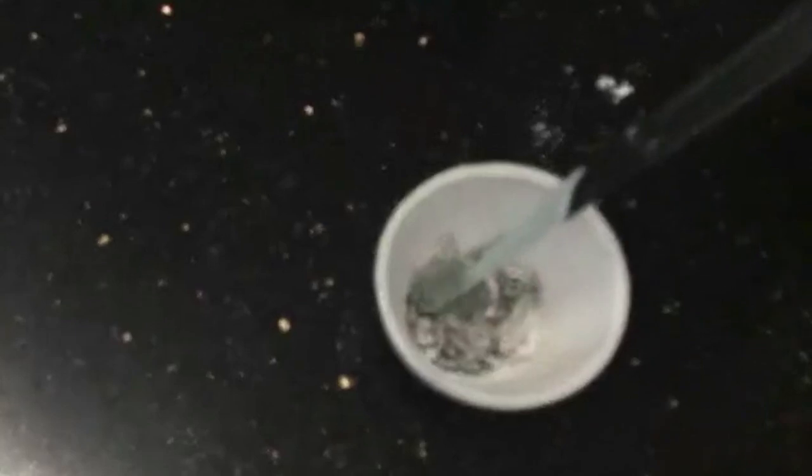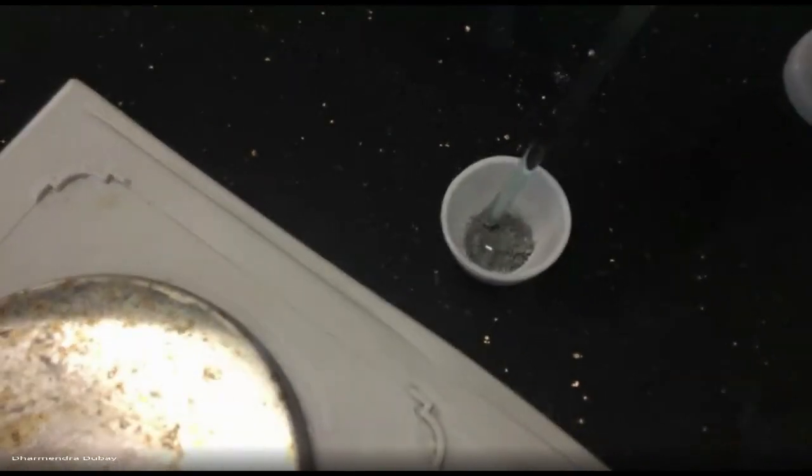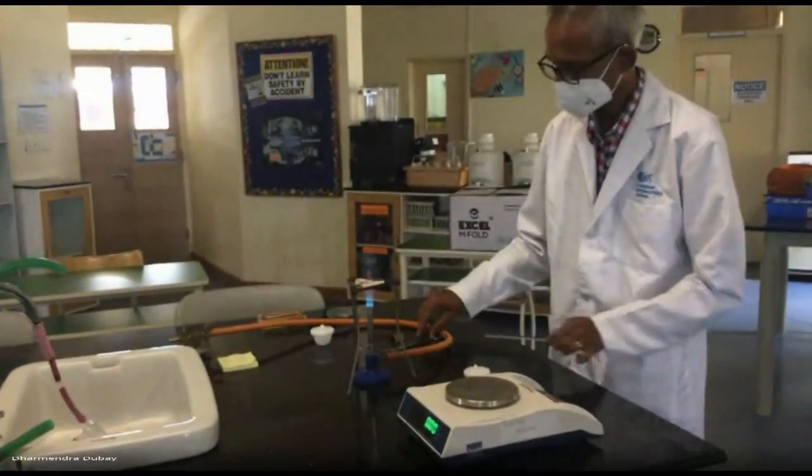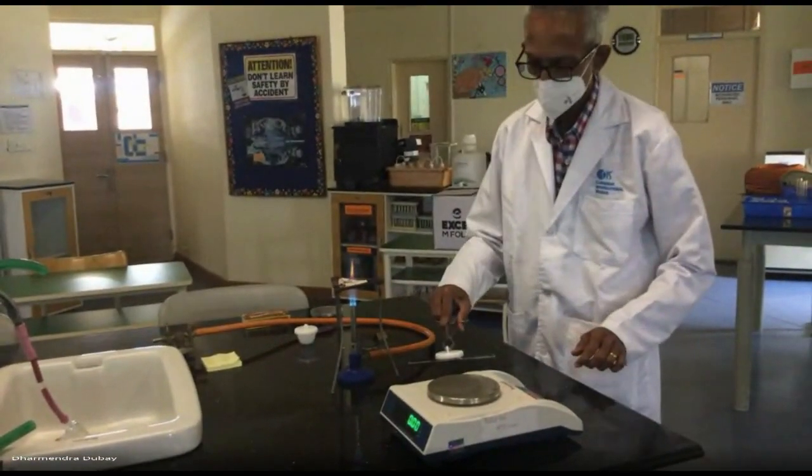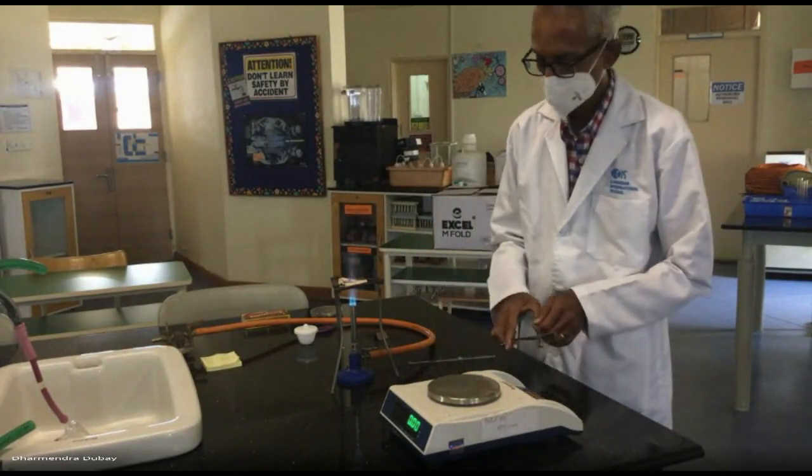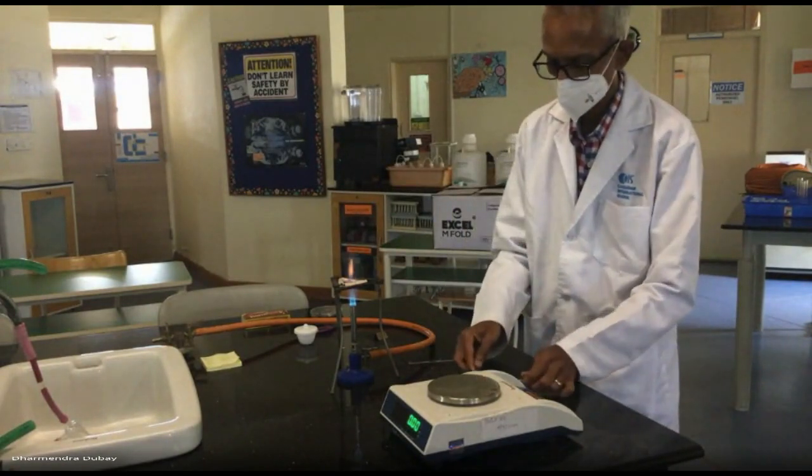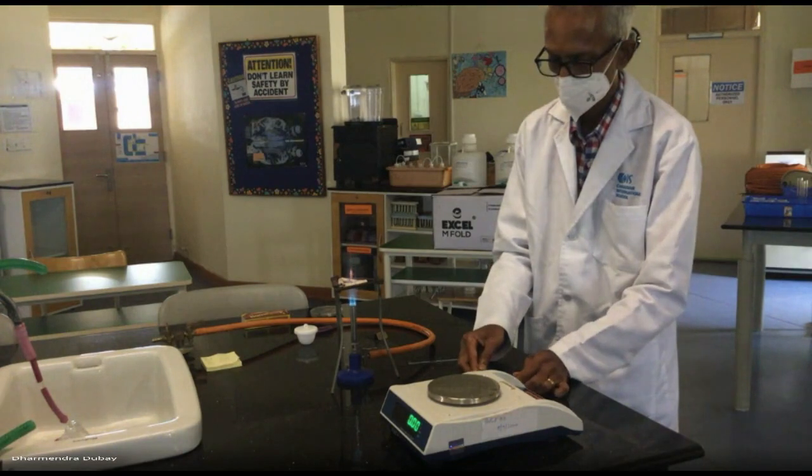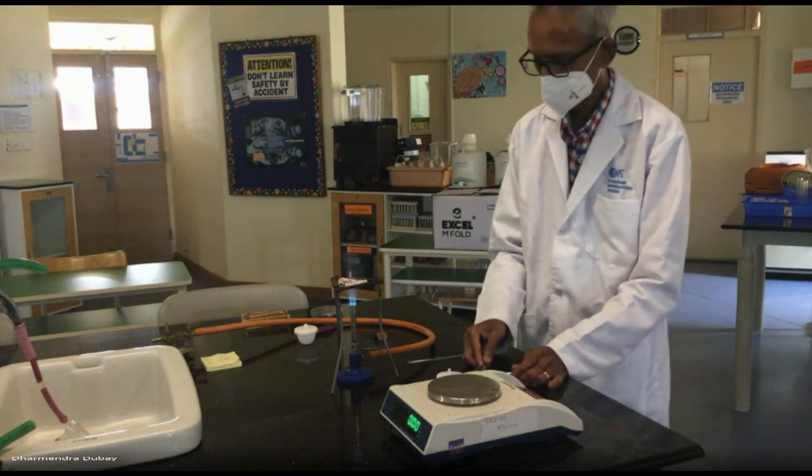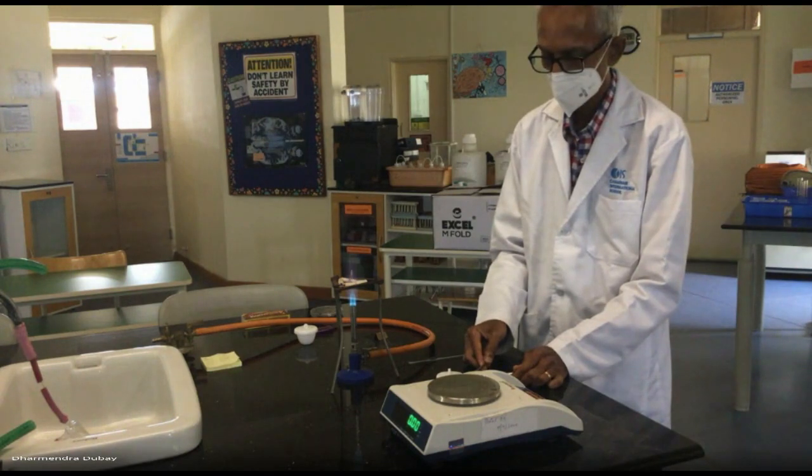What do you guys think about using this glass rod here now? If you use it to break down the clumped up particles, then since it's glass you can easily remove if you've taken anything on it. I agree with that. It's not going to stick too much on the glass rod. If we don't get the mass that we're expecting, one option that we have is to put it back over the flame. It's a sign possibly that all of the magnesium is not reacted. And we would just let it heat some more and undergo some more combustion. And if we leave it for another 15 minutes and the mass doesn't change, we could say that we've done all that we can do.